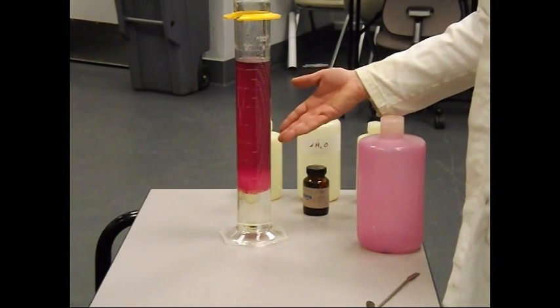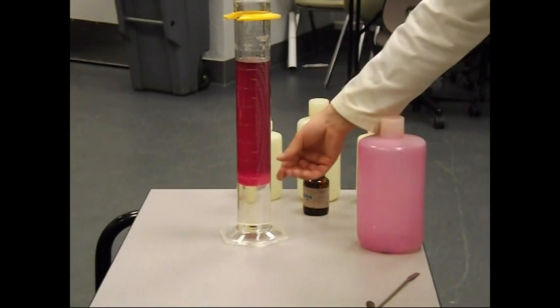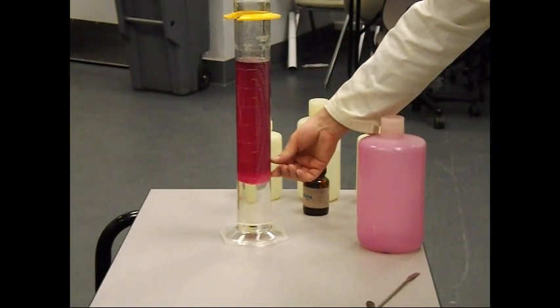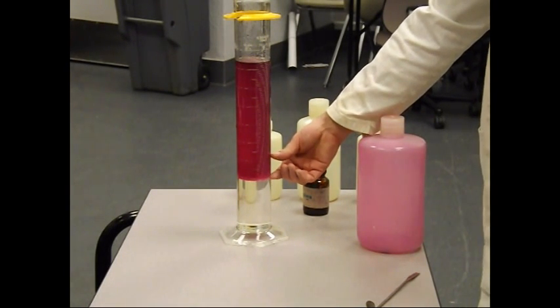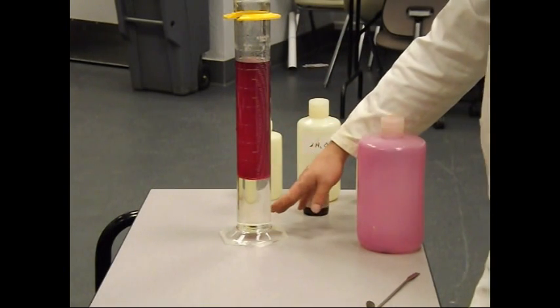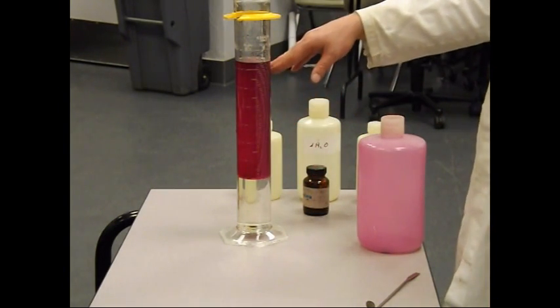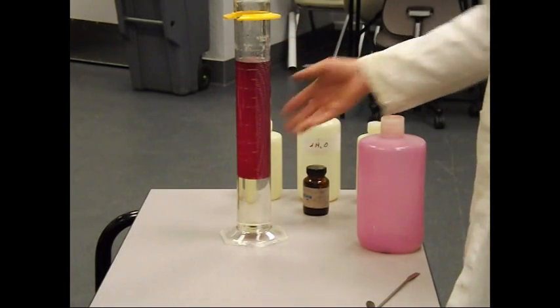So, but water will not, and that's what's happening down below. While I have shaken it up, as you can see there's a lot of bubbles right here and that bubble layer is moving. That bubble layer is called an emulsion layer in science. It's slowly breaking apart. The water is sinking to the bottom, and the hexane and dichloromethane is at the top. And you can see all of the iodine is sitting in the top layer.